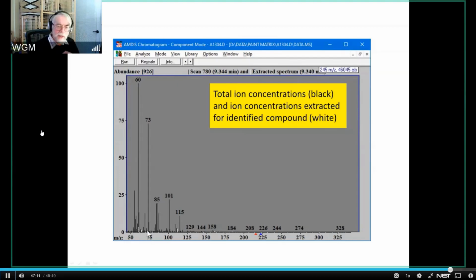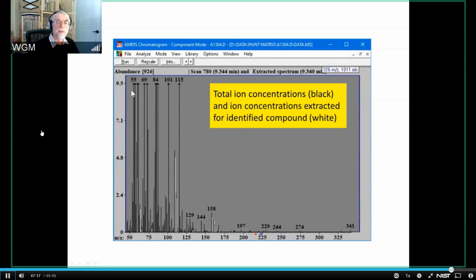So you're seeing a very tiny amount of material here, and I'm going to blow this up by a factor of a little more than 10 so that you can see. You're seeing very, very low concentrations of these ions, and yet you're actually capable of identifying these things. And that's really the power of AMDIS.